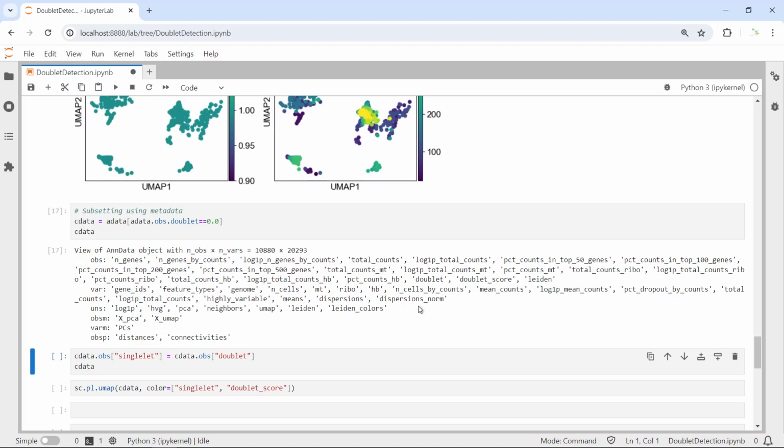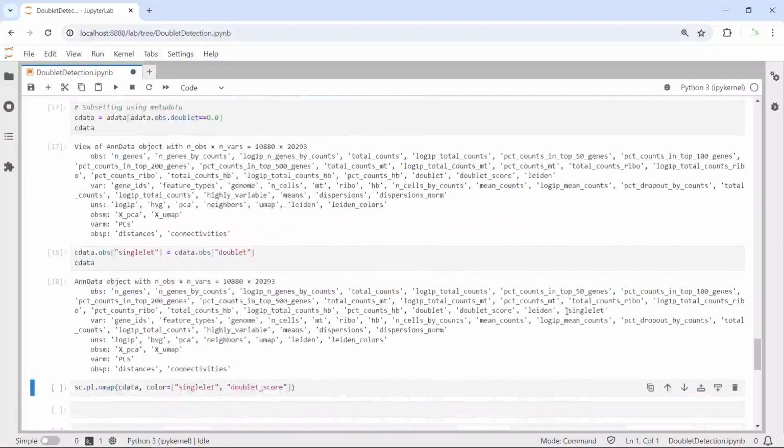So after subsetting the data, we kept all the cells as singlet, but the column name is still doublet to show all the singlet in the data set. So we can generate a new metadata column as singlet. Let's run. You can see we added a new column as singlet. If you want, you can also delete the doublet column. Now we can generate a new UMAP to show the singlet.